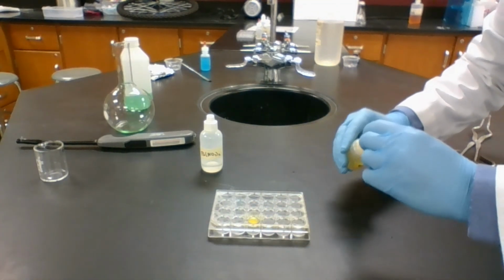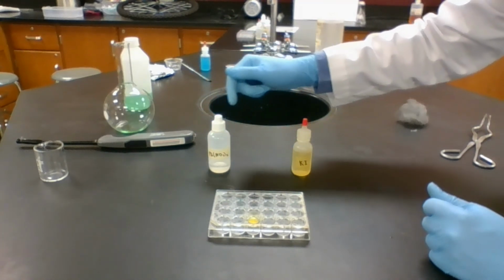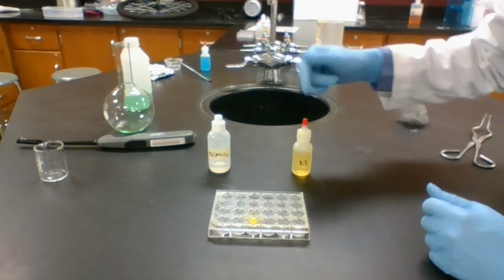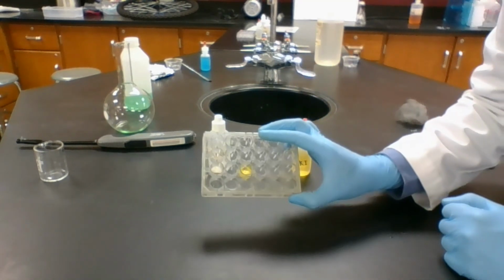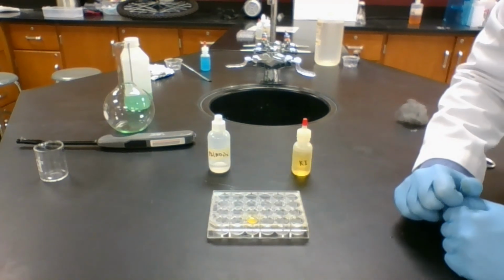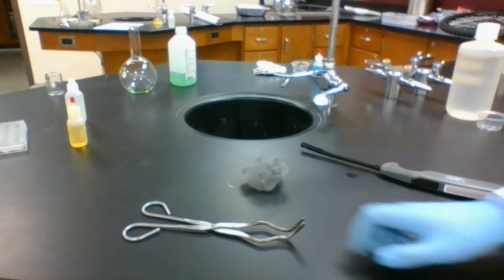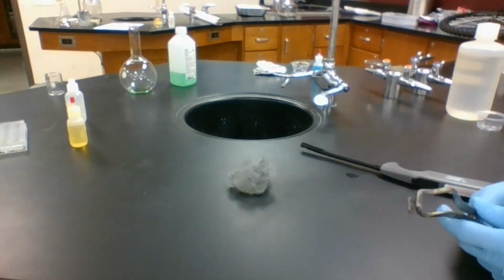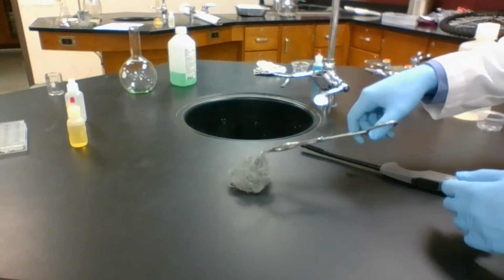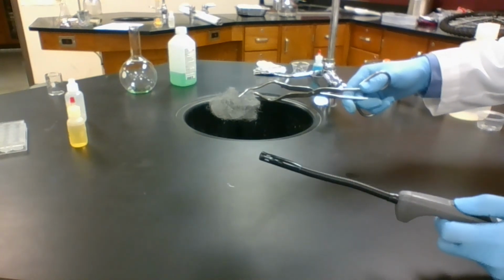The liquid left over that reacts is potassium nitrate, KNO3. And our solid stuff, our yellow stuff in here, is lead iodide, PbI2. Station 5 is a reaction between iron metal and the oxygen that's in the air already. To get this reaction to go, we're going to get this up in the air and use a lighter.